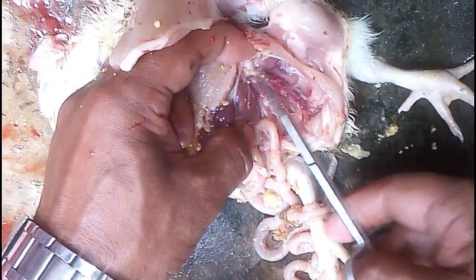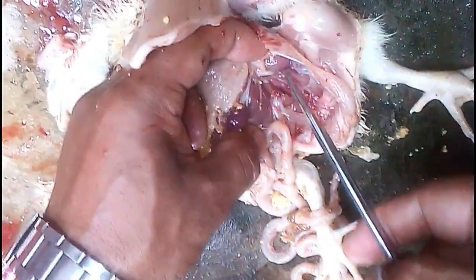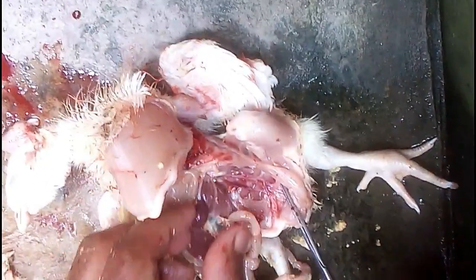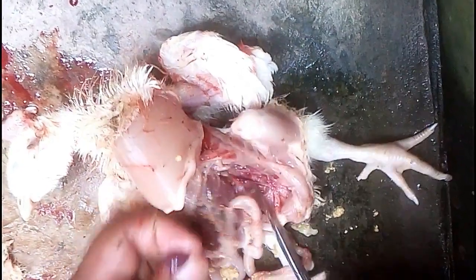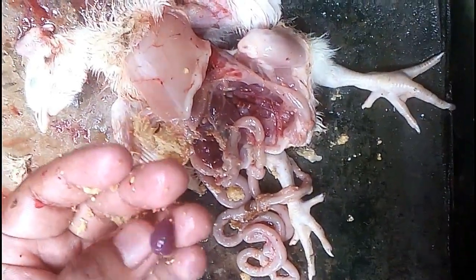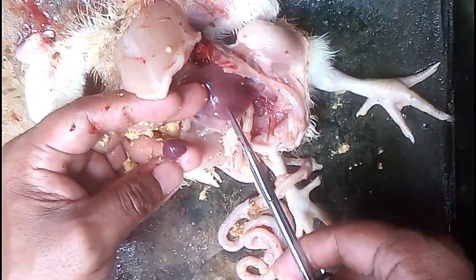This is the kidney. The kidney shows discoloration — a blackish colour — which is caused by a poor immune system.